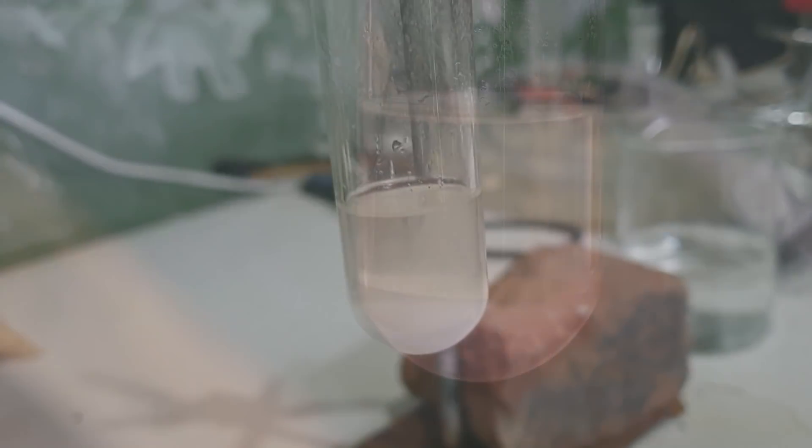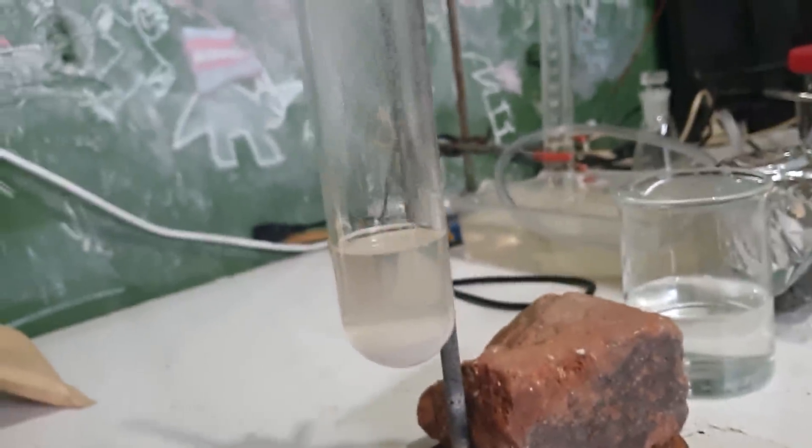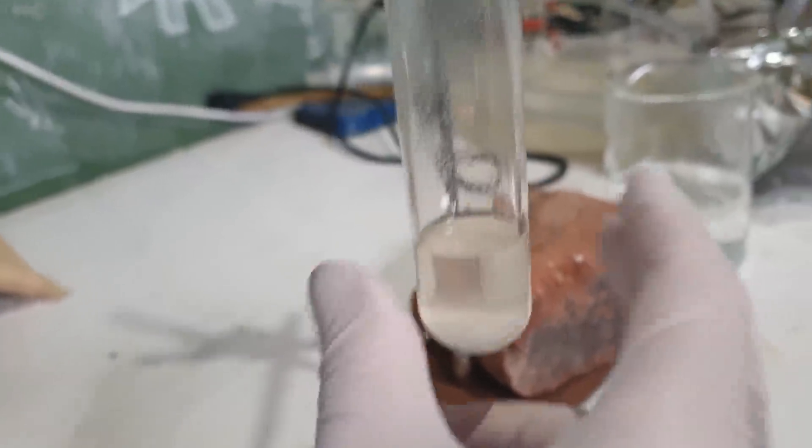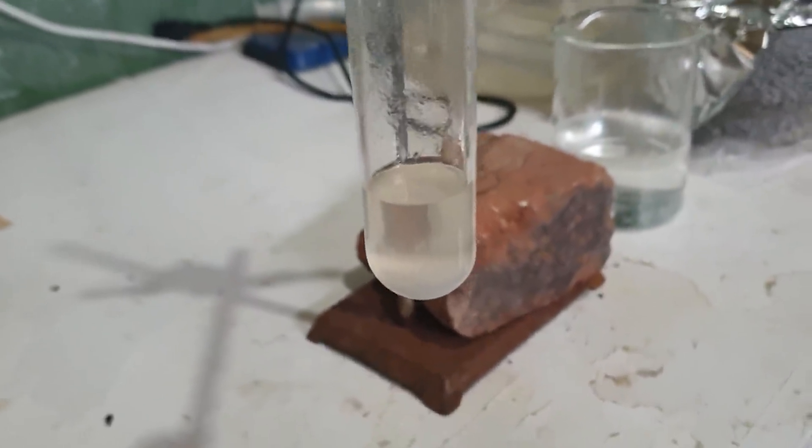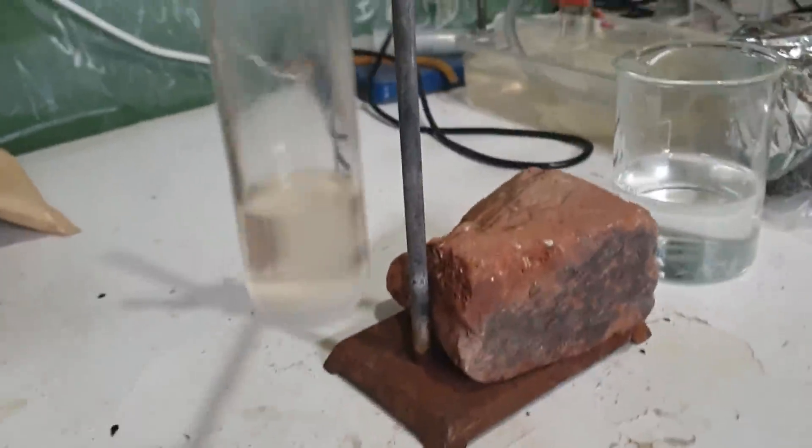All right, that was great. Looks like we've got a nice precipitate here. It's settling out very fast, indicating it's quite dense as we'd expect from a heavy metal. I might just cool the solution down. It's a little bit warm from the reaction of the ammonium bicarbonate and the nitric acid. No worries. Simple chemistry, but you've got to be pleased when things work.